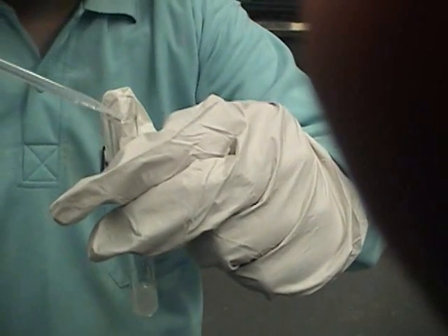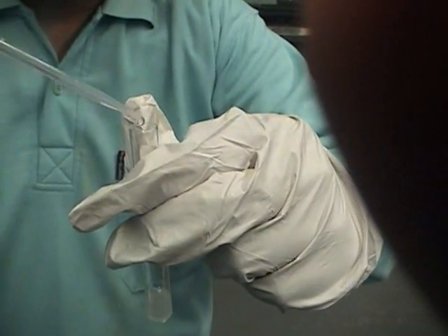With a Pasteur pipette, sample the bottom layer and drop it onto pH paper to check that it turns blue, indicating a basic solution.